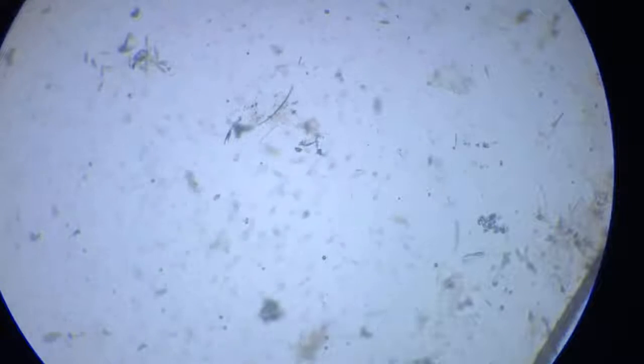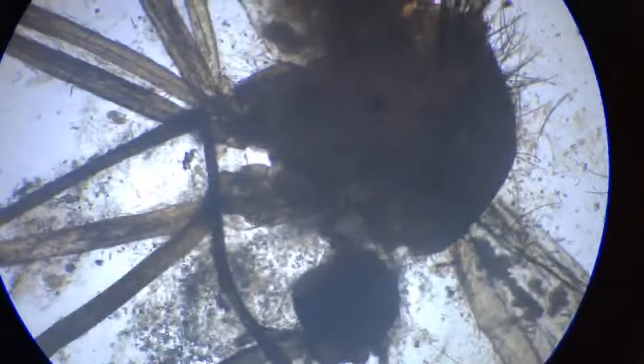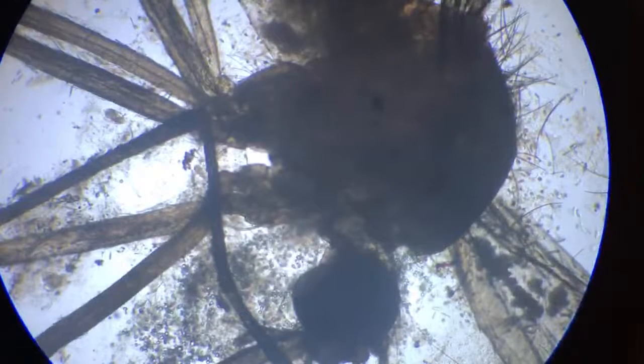So, first, I'll bring you to the mosquito. Here it is: the mosquito's head, its wings, the thorax, the abdomen, and its various appendages. Now, prima facie, there doesn't seem to be much happening other than some ciliates. We shall definitely zoom in a bit.